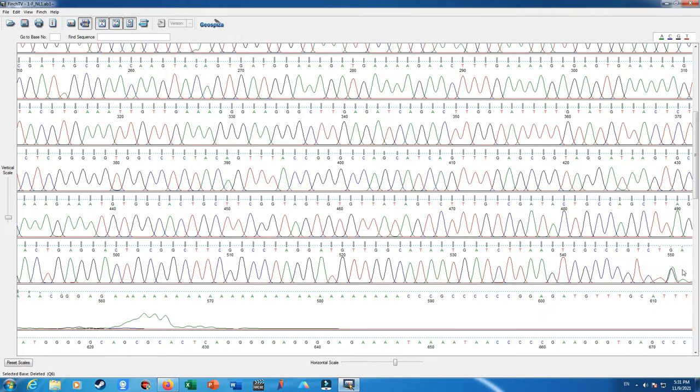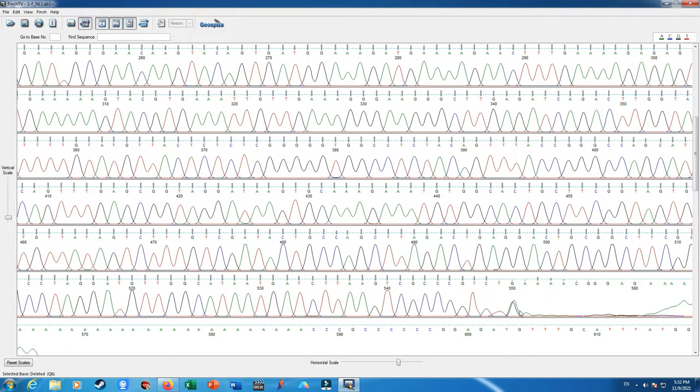As you see, some nucleotides are about to overlap with each other, like guanine and the nucleotide behind it, thymine. One may think that the thymine is another nucleotide here, which may be correct, but the thymine here with the quality of 11 is also in the range of our threshold, so I choose that the thymine must be in our sequencing result, and the guanine is also correct here.